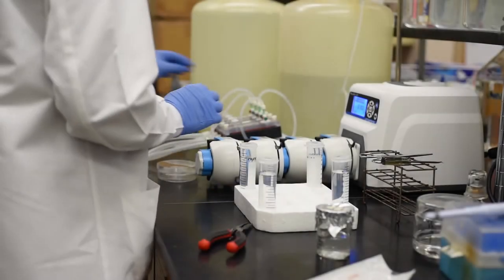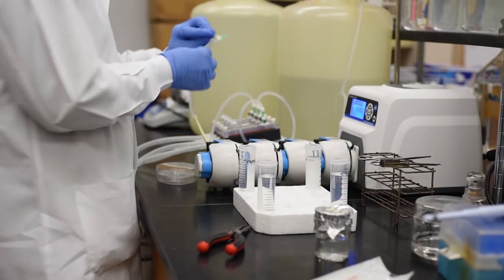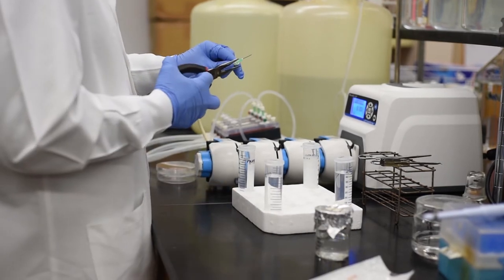At the end of the continuous flow phase, the biofilm-covered slides are ready for sampling. To remove a slide, turn the pump off.